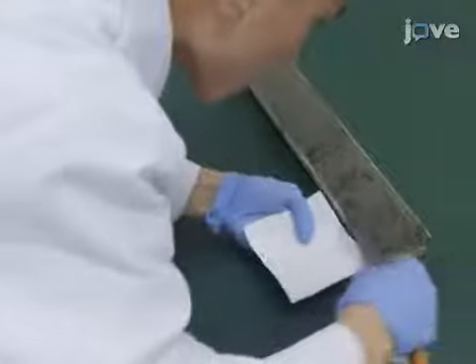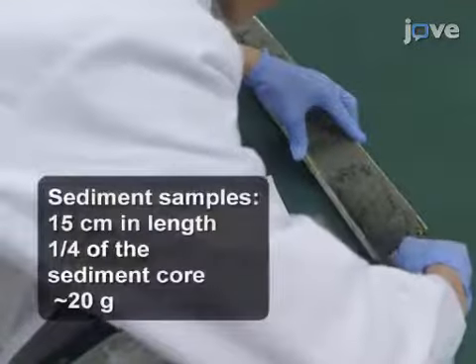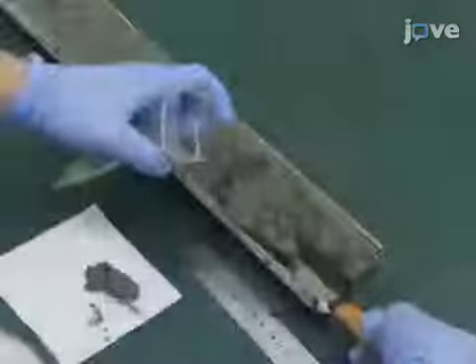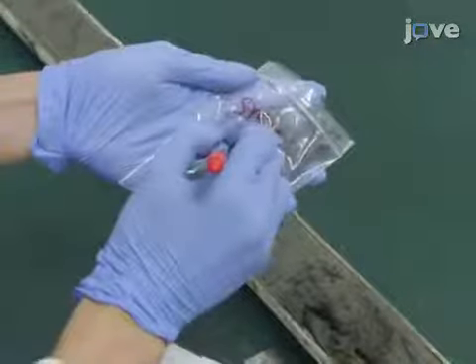To begin, clean the surface of a sediment core and collect a set of samples across the entire length using a knife. Pack the wet samples individually in zippered plastic bags and label them using a marker.